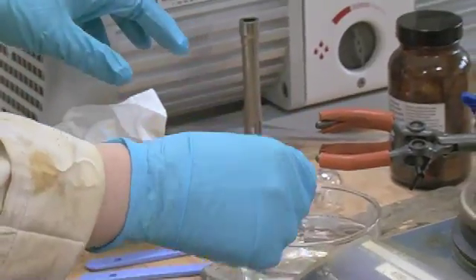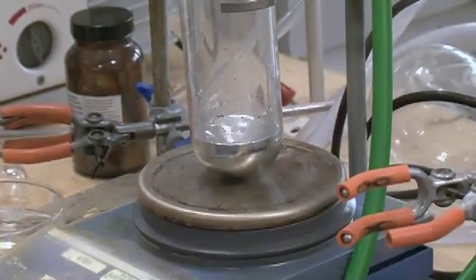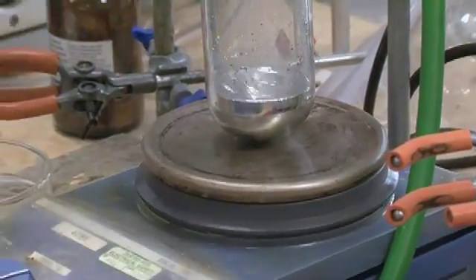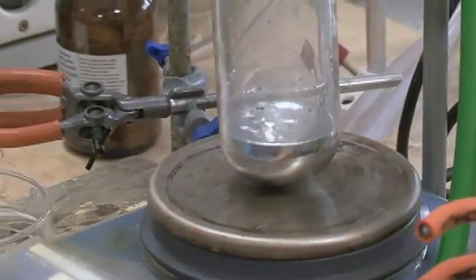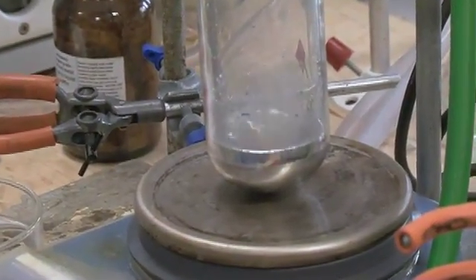We'll keep going for a little while. So what I'm doing is I'm taking some of the sodium out of the hexane, I give it a little bit of wipe to get rid of excess hexane, and then it's going in. So there's argon gas here, and it slowly dissolves in the mercury. And you see it fizz when it goes in.